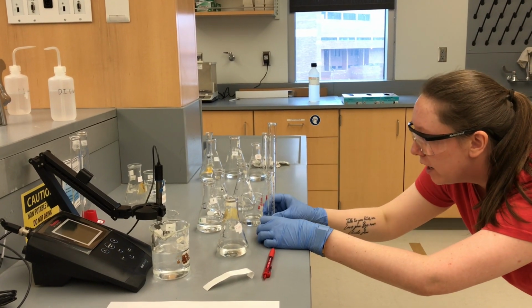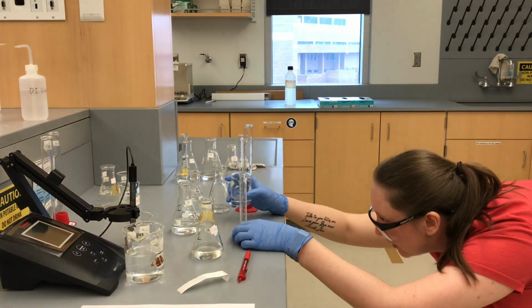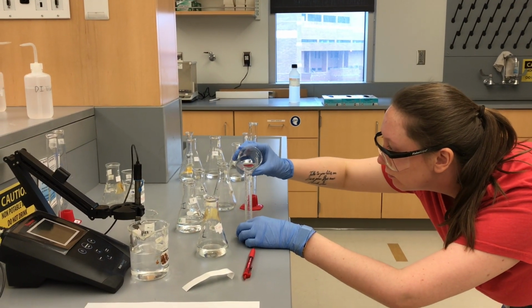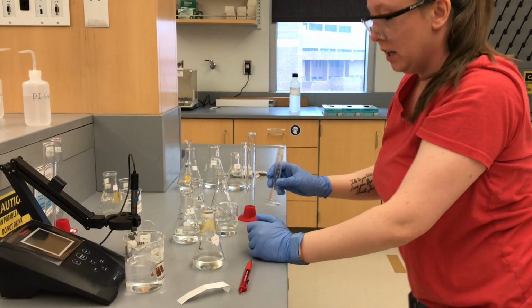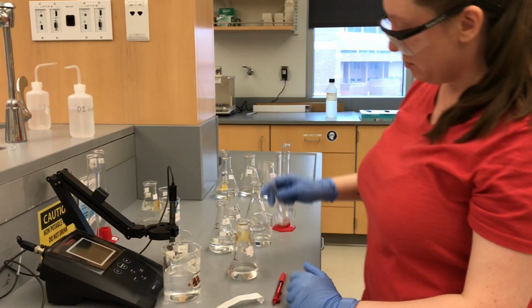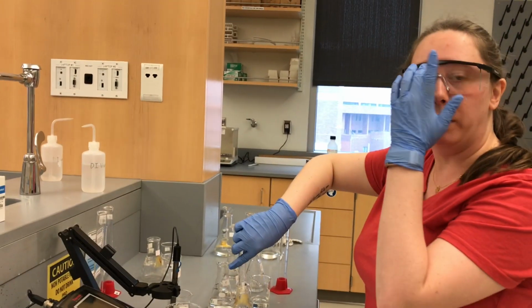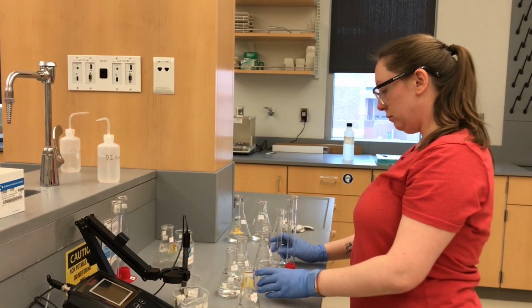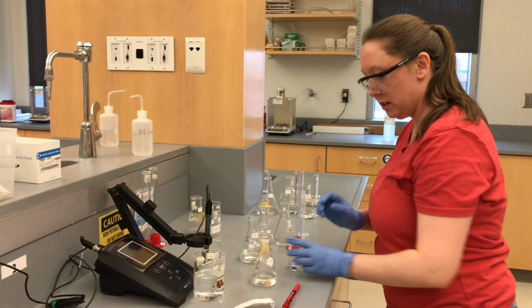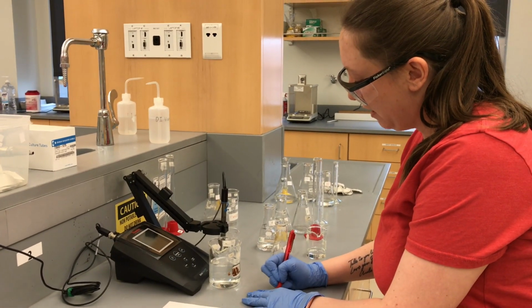So a pipette would be ideal. Alright, I give up. Alright, so it's a tiny bit more than 2, but that's gonna be a source of error. Okay, so this is our HCl, so I'm gonna write a new sticky. Always label your labware.